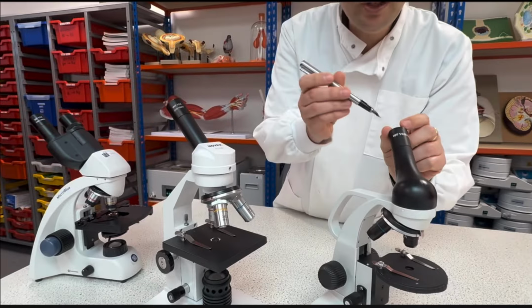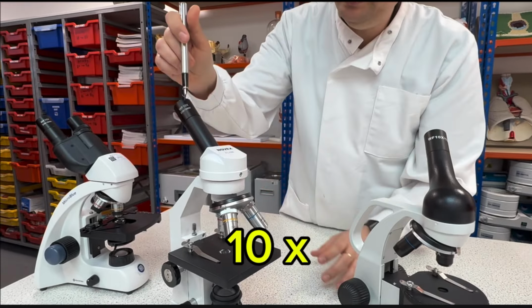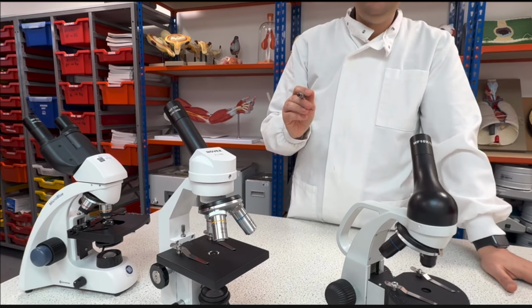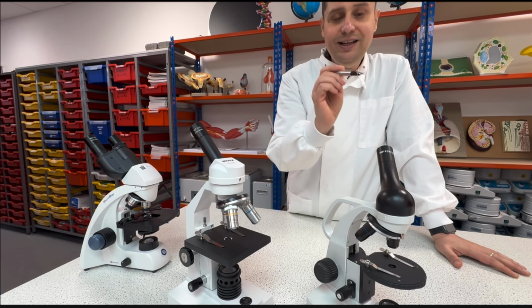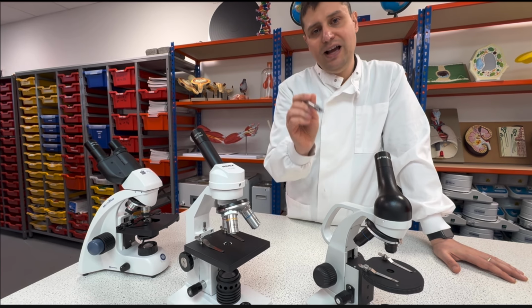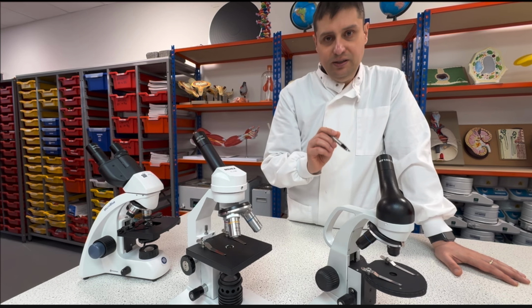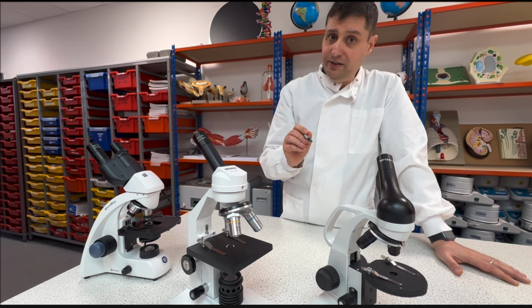For this one, for example, it is 10 times, this one is 10 times, and this is 10 times. What does this mean? This means that the lens magnifies the real size of the object you see 10 times. So 10 times is not enough for you to see something microscopic.